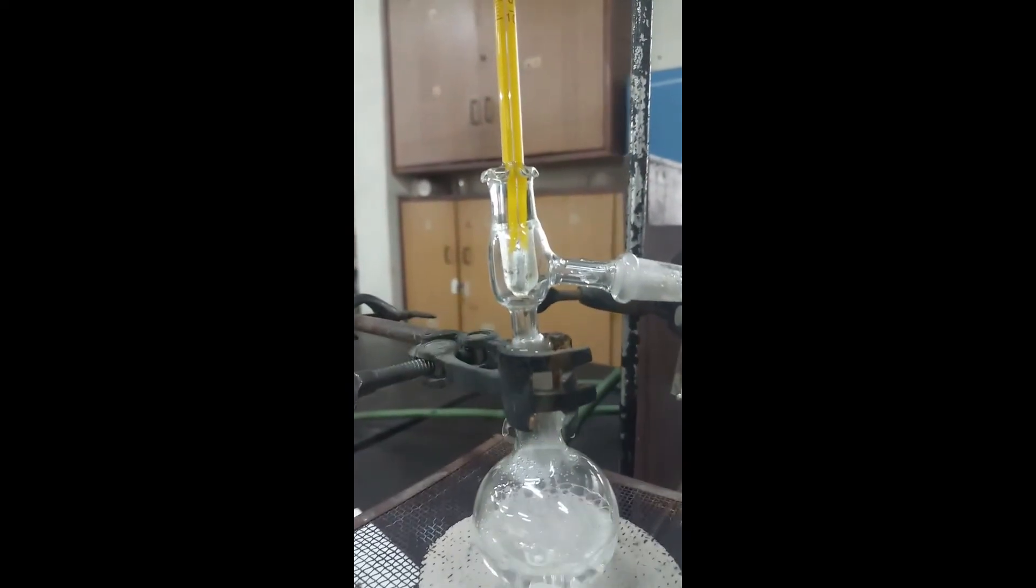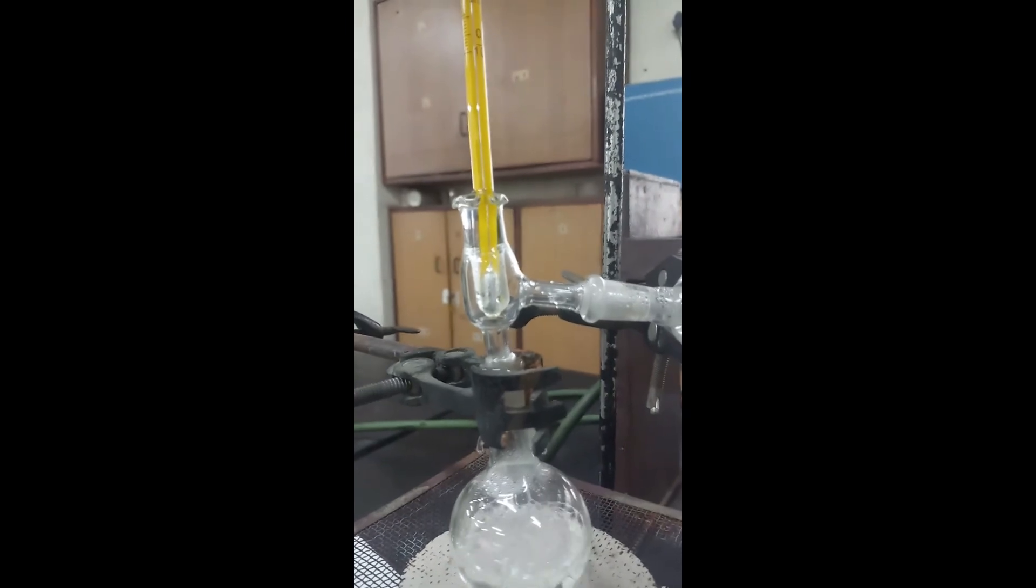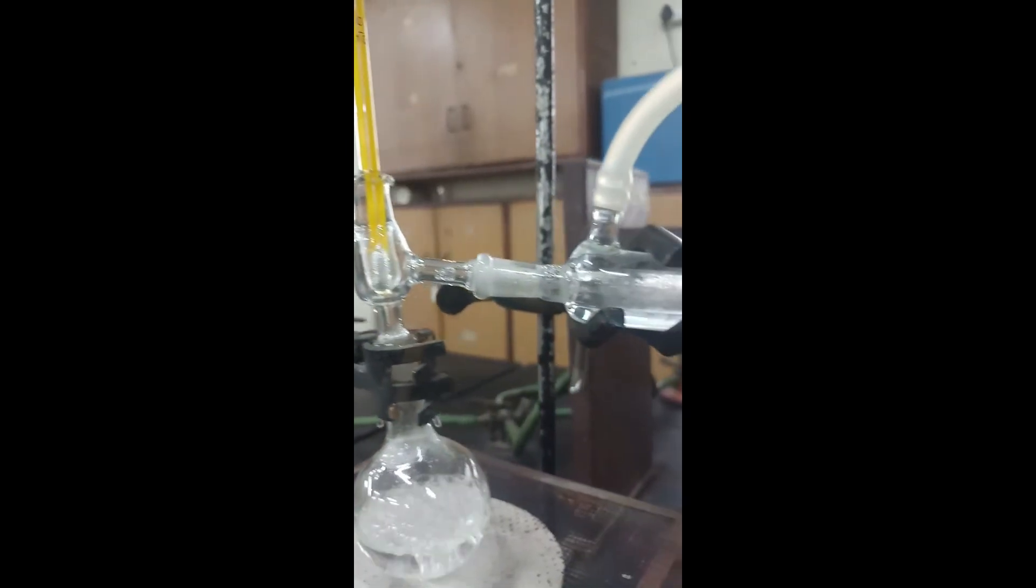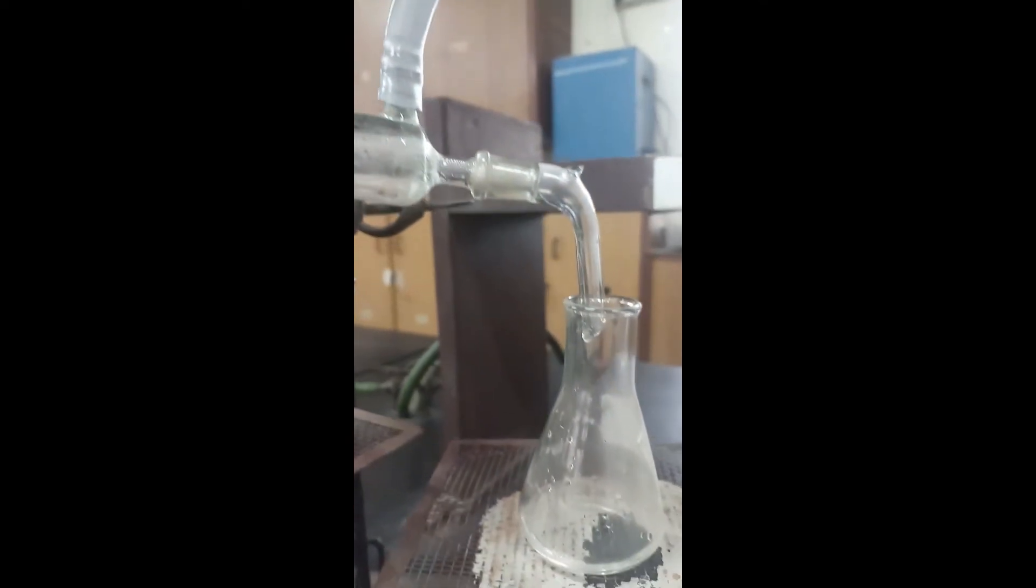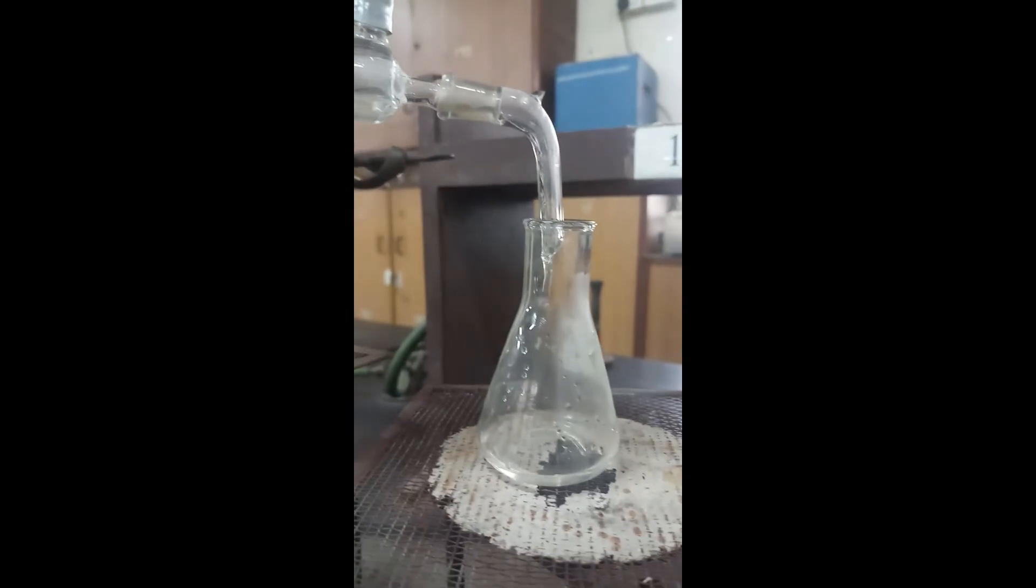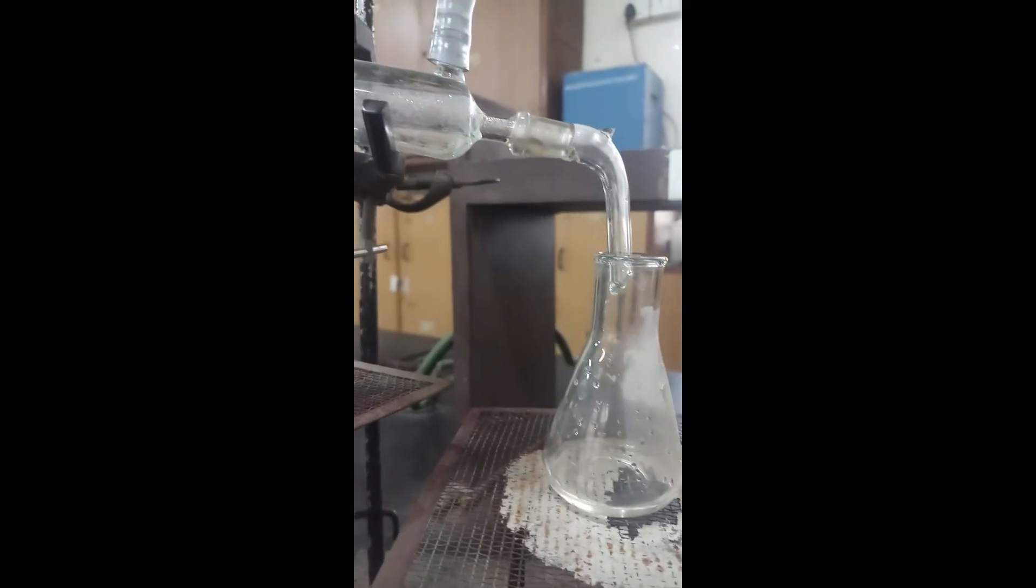After some time, once the first component gets completely vaporized and collected in the receiver flask, this is how it is getting collected in the receiving flask.